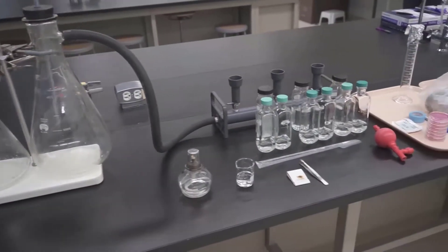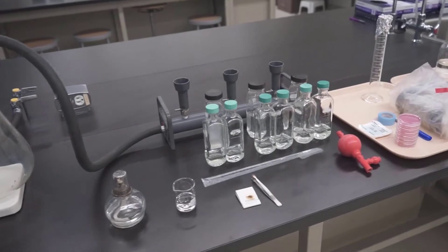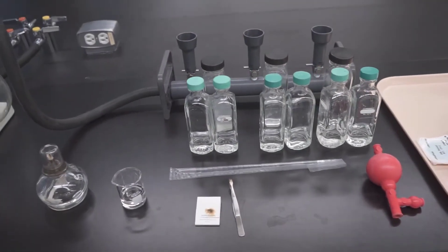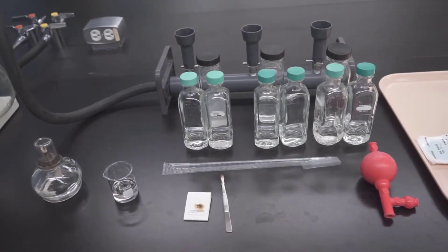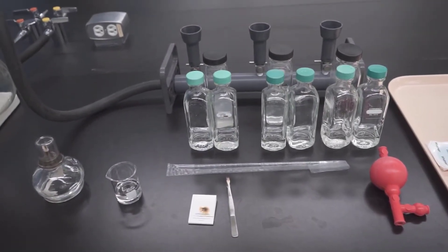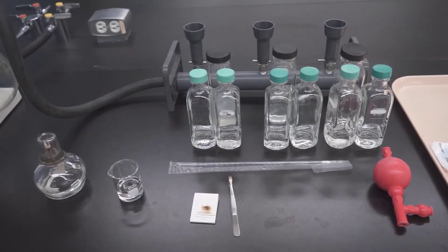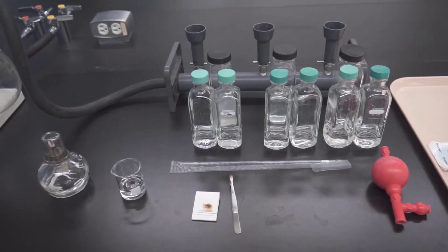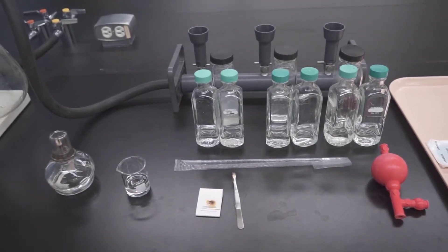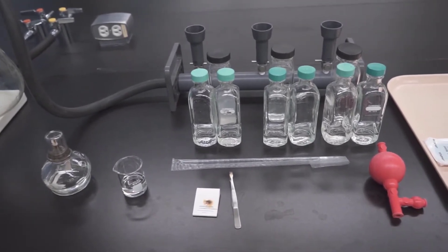Hello everyone! In this lab, we will learn how to determine the concentration of total coliform indicator bacteria using the membrane filter technique.